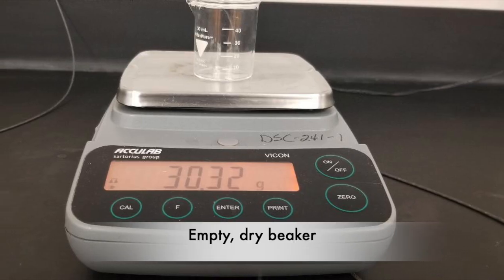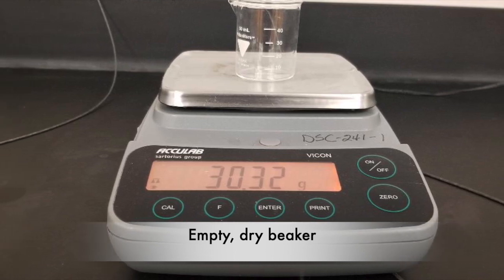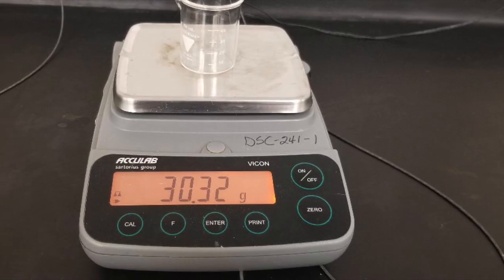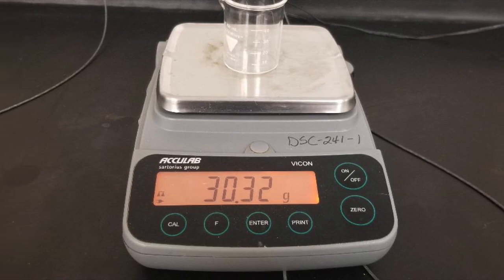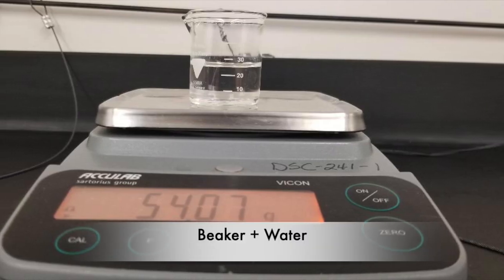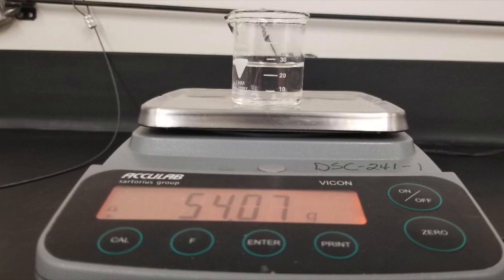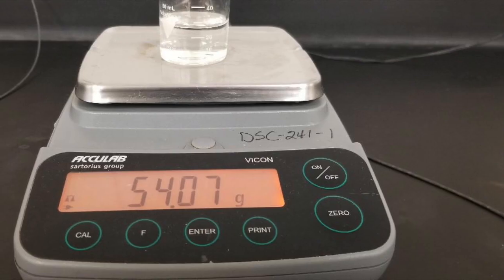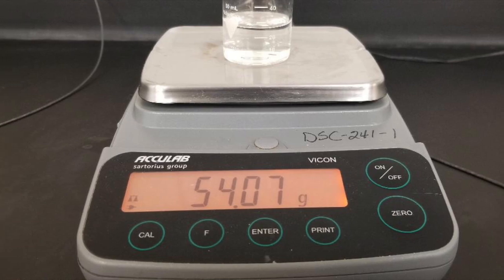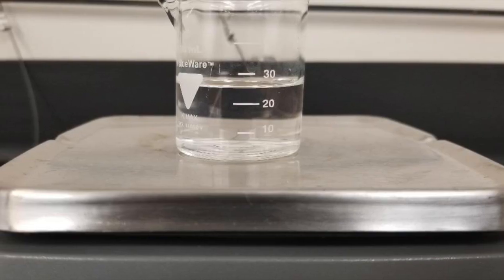Transfer the water from the cylinder into a dry 50 milliliter beaker and take the measurements as described in steps 6 and 7 of your handout. Read the number and record the mass in Table 2 found on page 7 of your handout. This information should help you complete the rest of your post-lab.